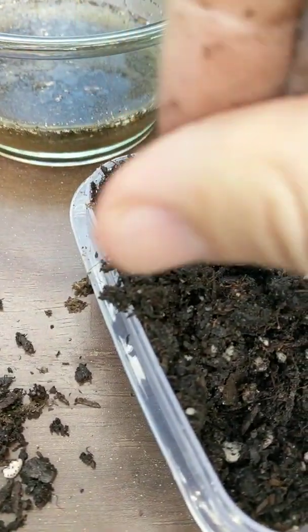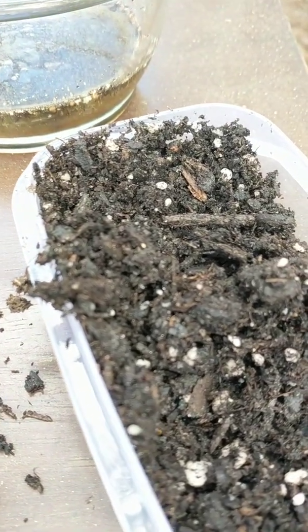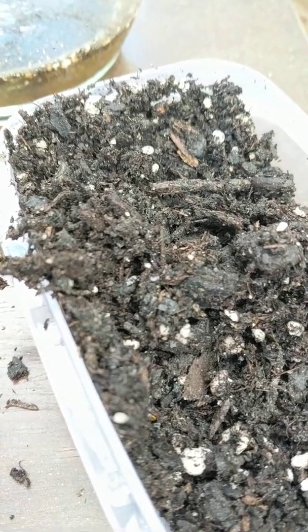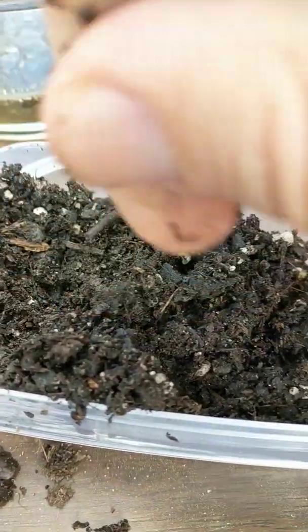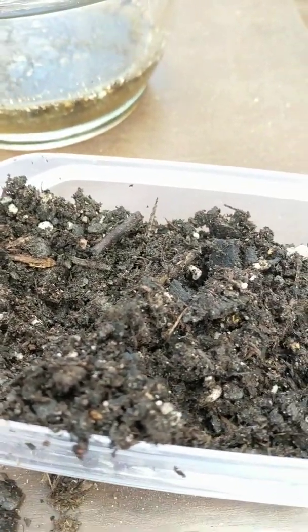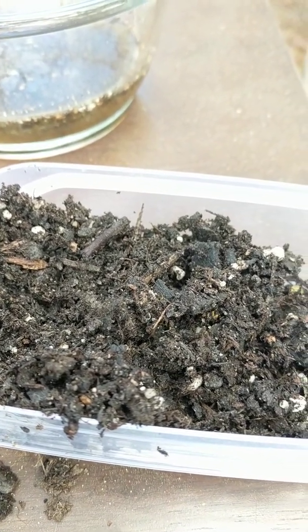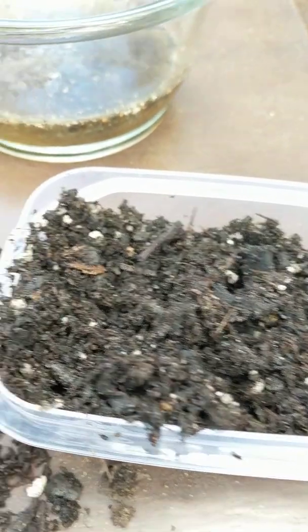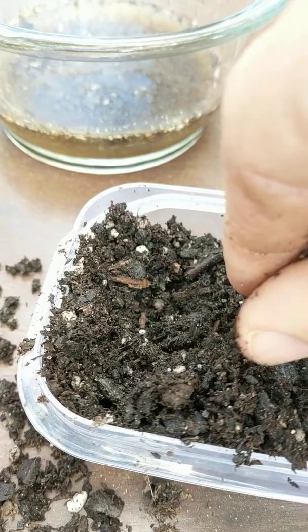On your document I forgot to put loam, but this is a silty loam, which is a decent soil for growing things here down in the south. Our sample is mostly silty loam, L-O-A-M, and we know this because it's smooth, not sticky. That's the smaller parts, and the loam is also part of the airy piece of the soil as well.